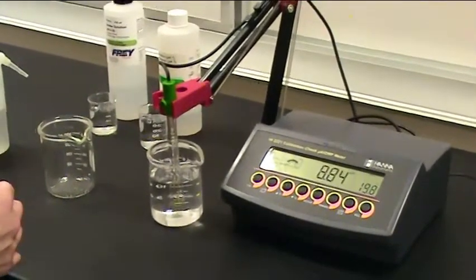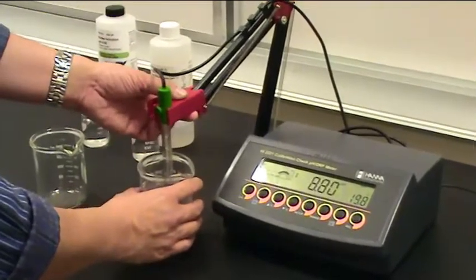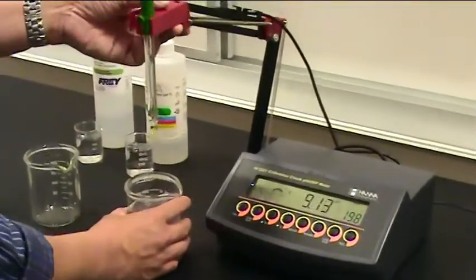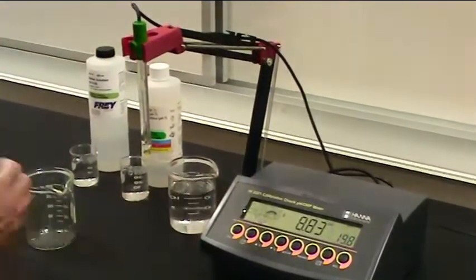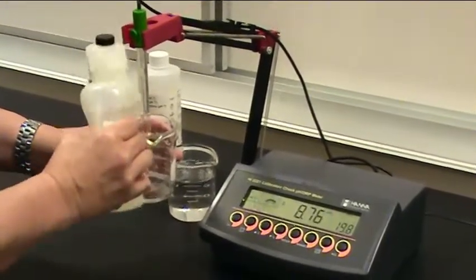So just like normal procedures, you start off the probe in some kind of holding solution to keep it moist. To do the calibration, we're going to remove the probe and rinse it to begin with.